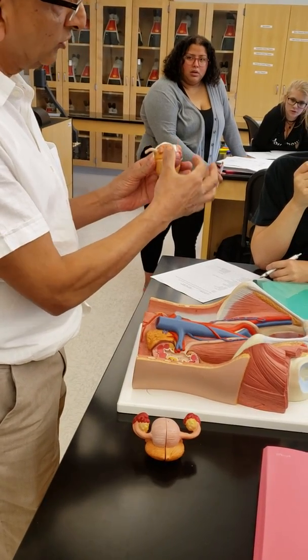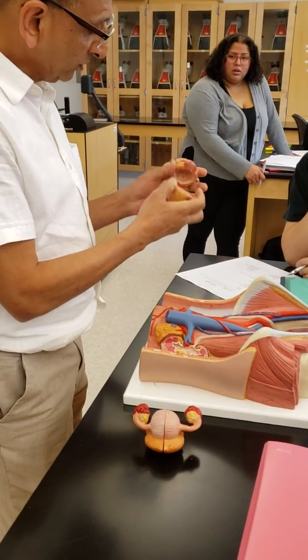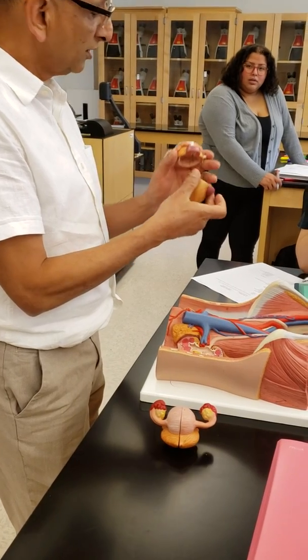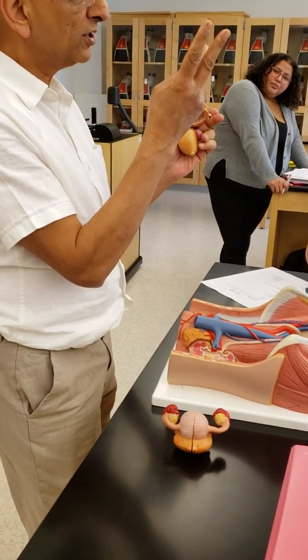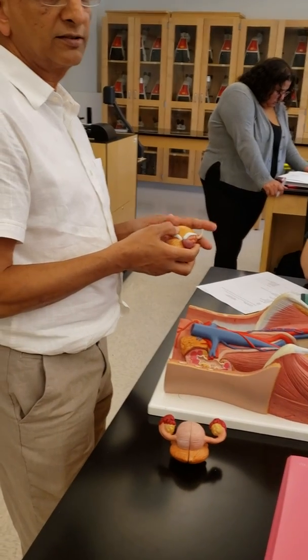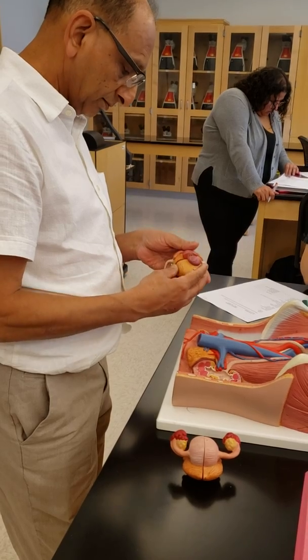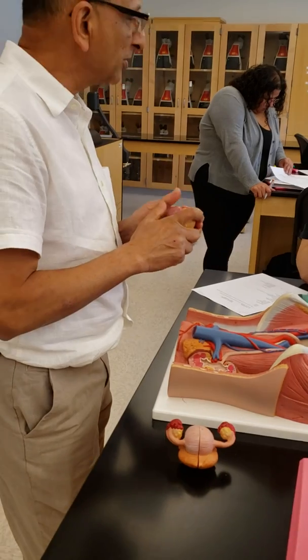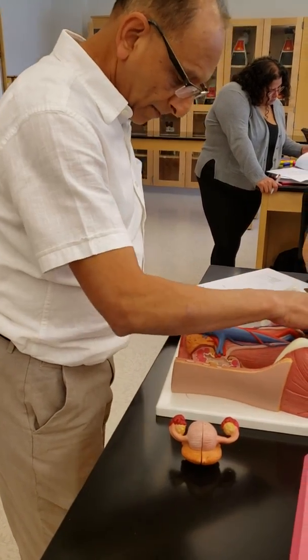Also what happens is, it is showing ureter opening here. We should be showing lower down here. And what happens is that you have two openings of the ureters, right? The bladder, and one opening going out, correct? Urethra. So three openings. So that three opening area is called as trigone. Okay. This is a trigone. And when we study the bladder, then it will be mentioned here in the bladder. Today we did the kidney, it's not mentioned here.